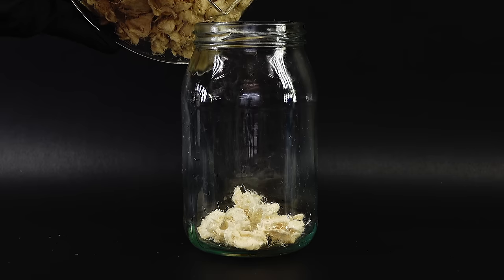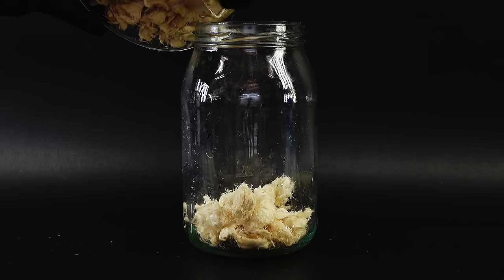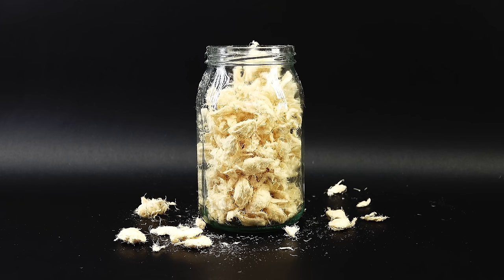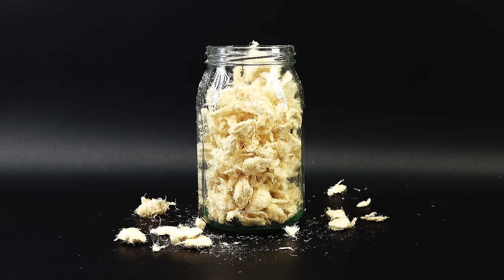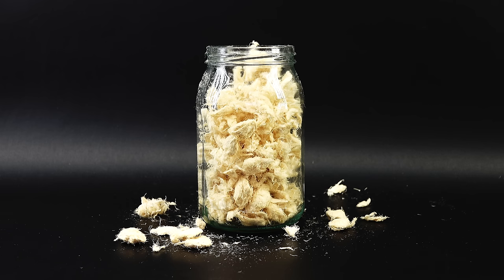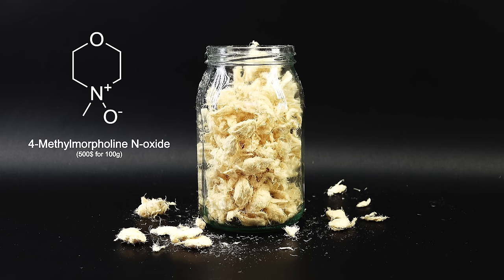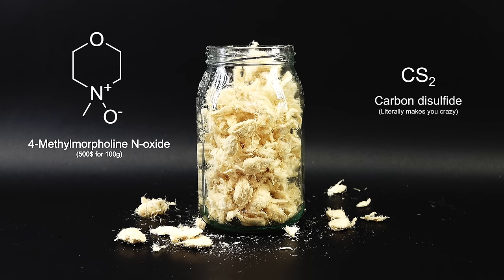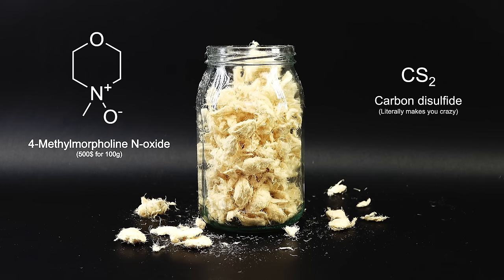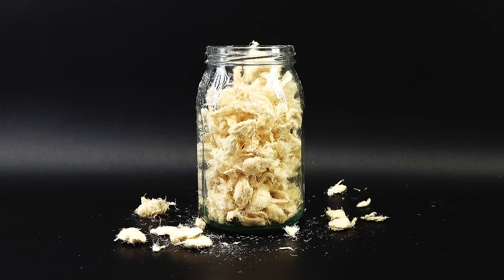Anyway, this step turned out way better than I expected, with me experiencing the gigantic paper industry on a tiny scale. Now, with this whole jar of cellulose ready, I can dissolve it in something. There really aren't many things capable of dissolving meaningful quantities of it, and most of them are expensive as hell or just outright banned. There is one, however, that while not even being a solvent, can dissolve cellulose quite well, and is surprisingly accessible to the amateur.